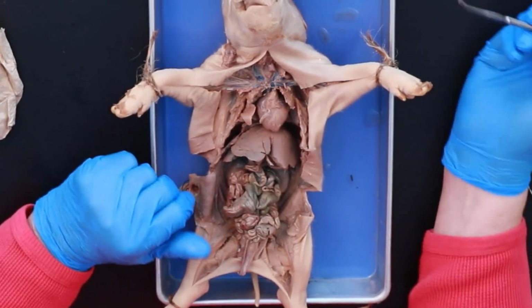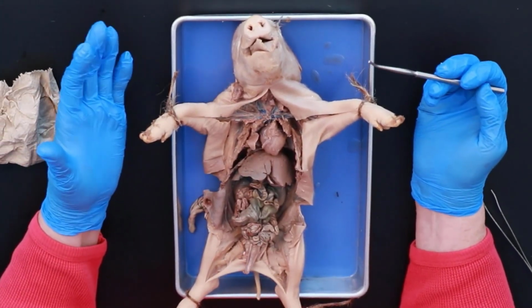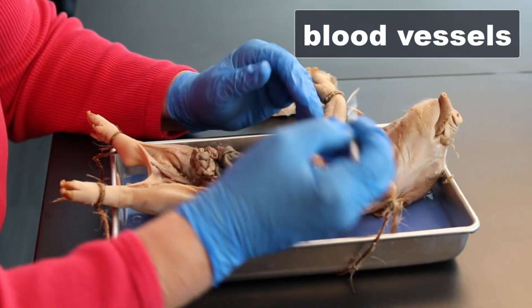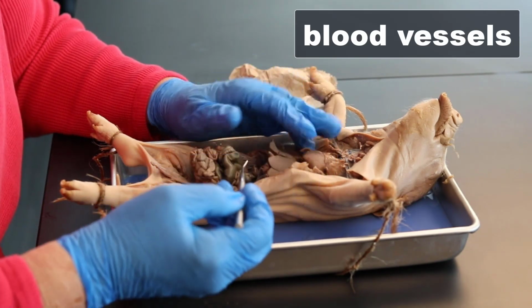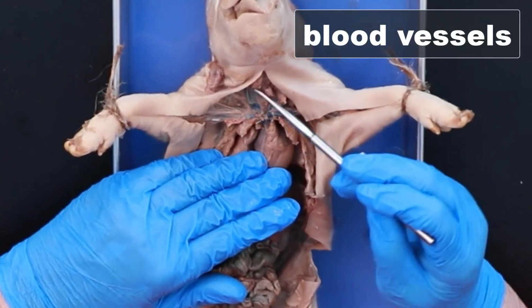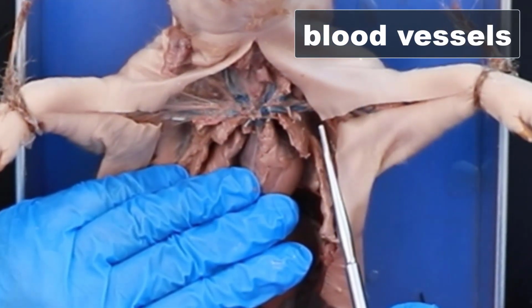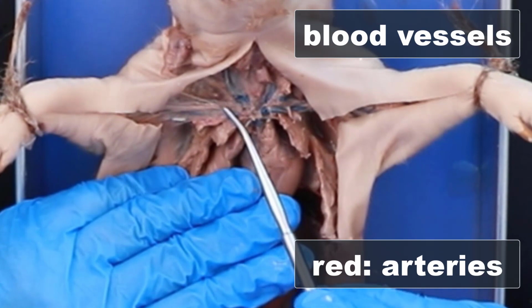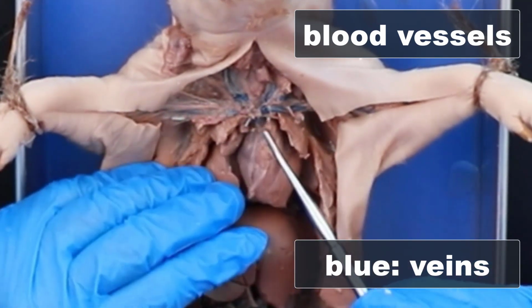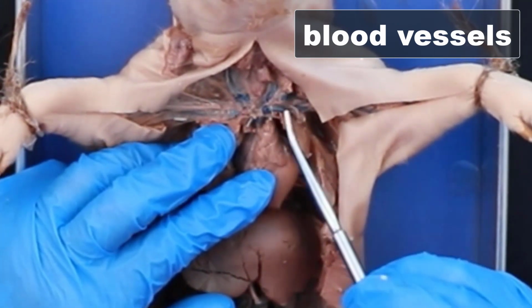Now, one of the other things that you need to understand for AP2 are the blood vessels. And these can get a little tough, but we're going to work our way from head to toe here. All right, and you can see we have actually got these vessels dyed. So the red are the arteries and the blue are the veins on most of these, except again, pulmonary circulation.